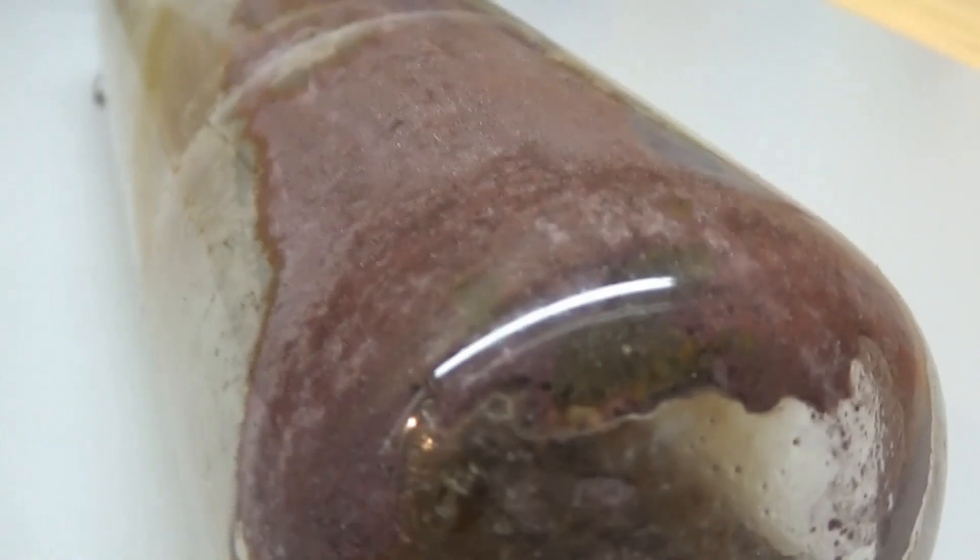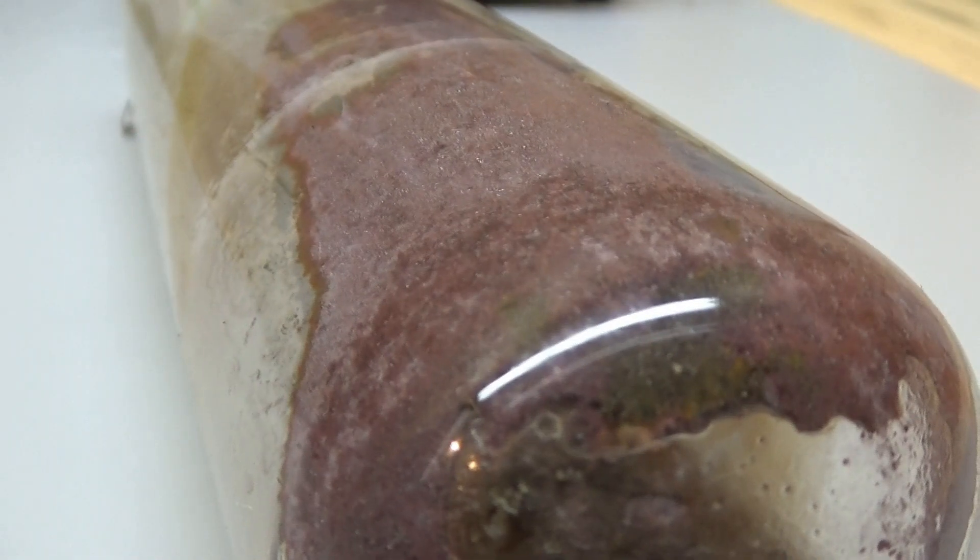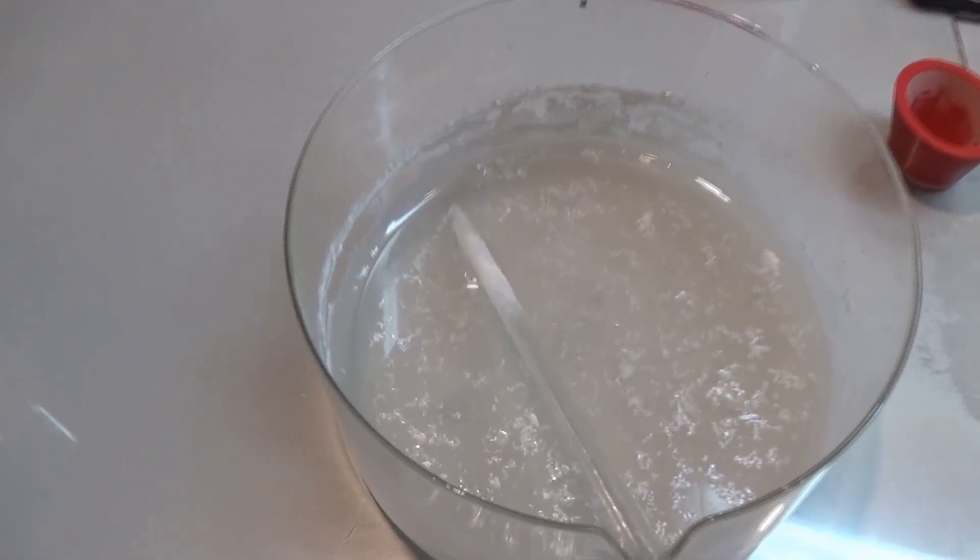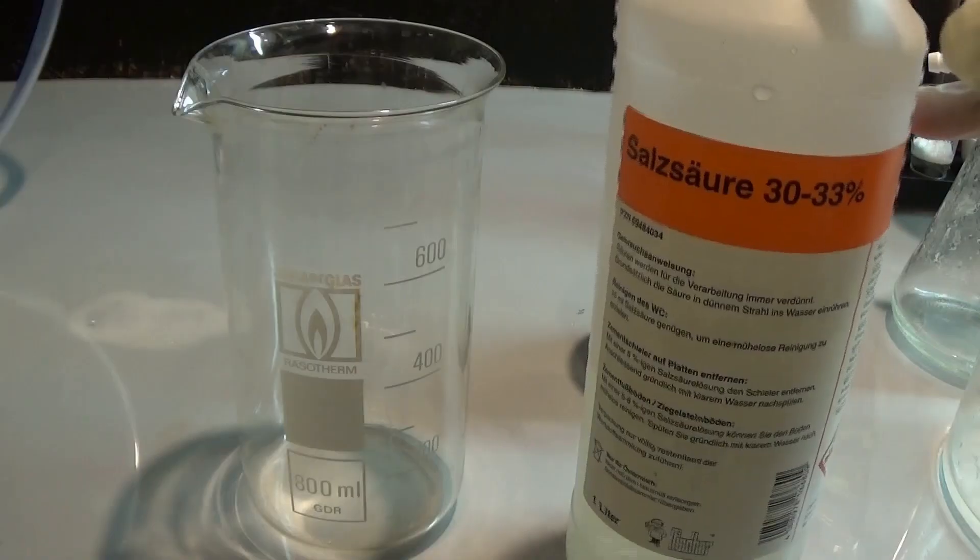After all of the color has faded and the reaction is completed, I went on and transferred everything into a pyrex evaporation dish. But then there were complications, like really bad ones.